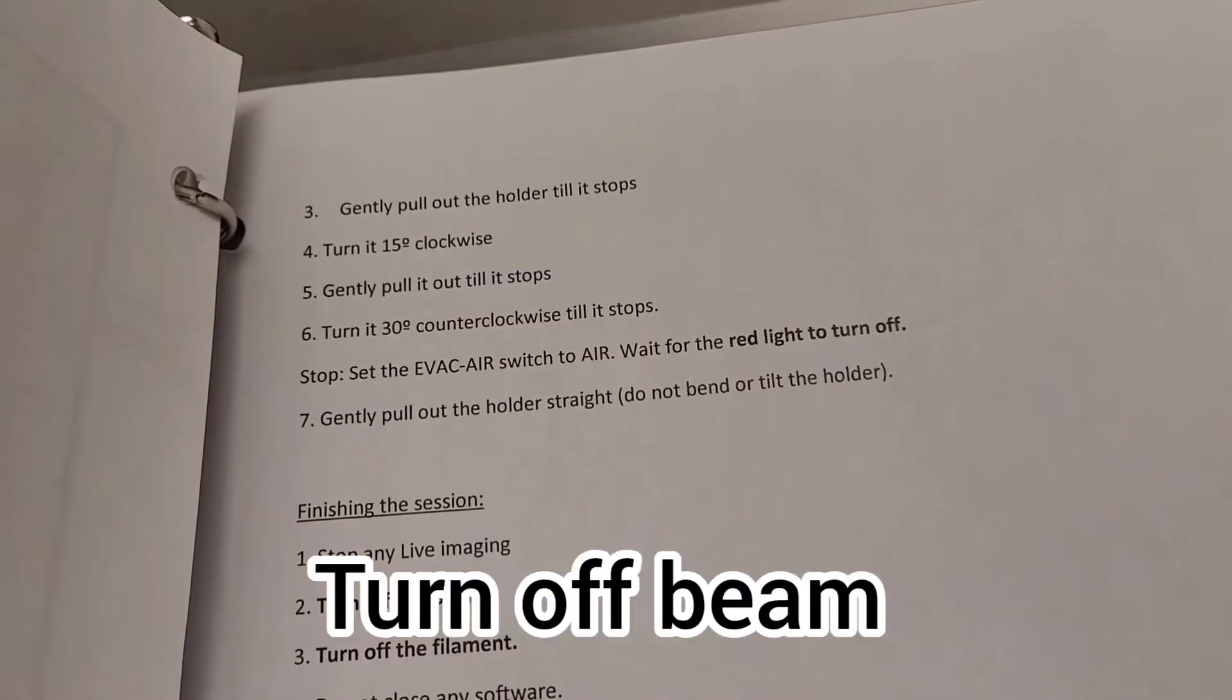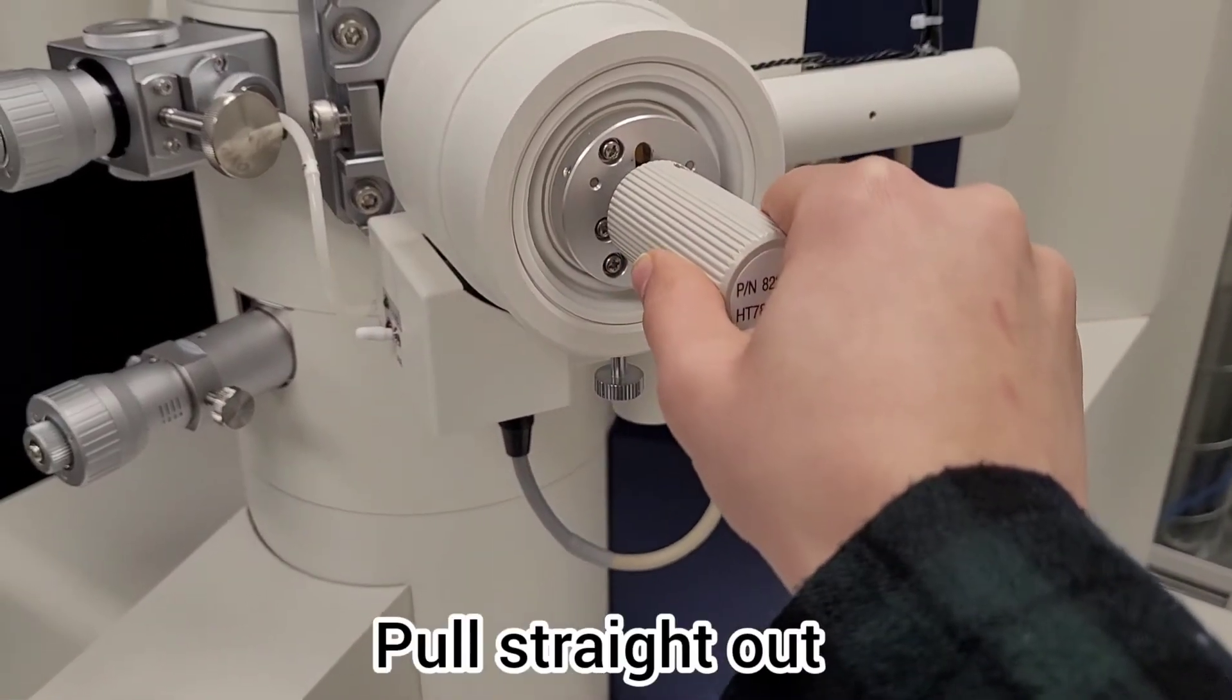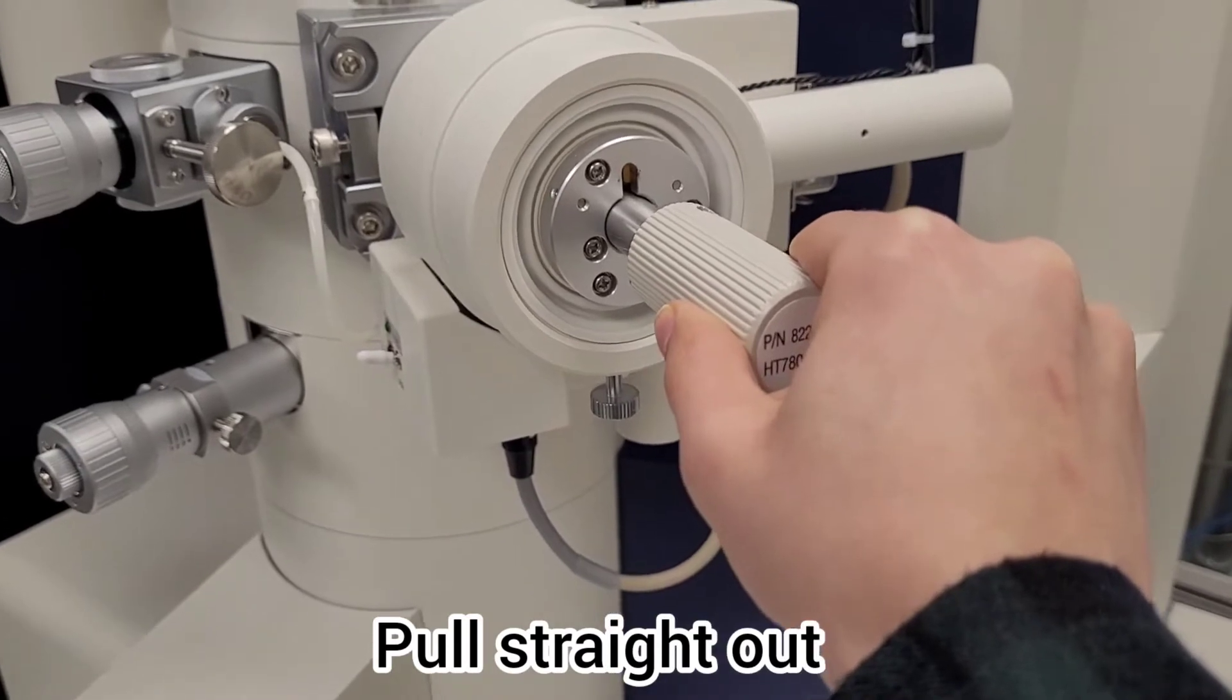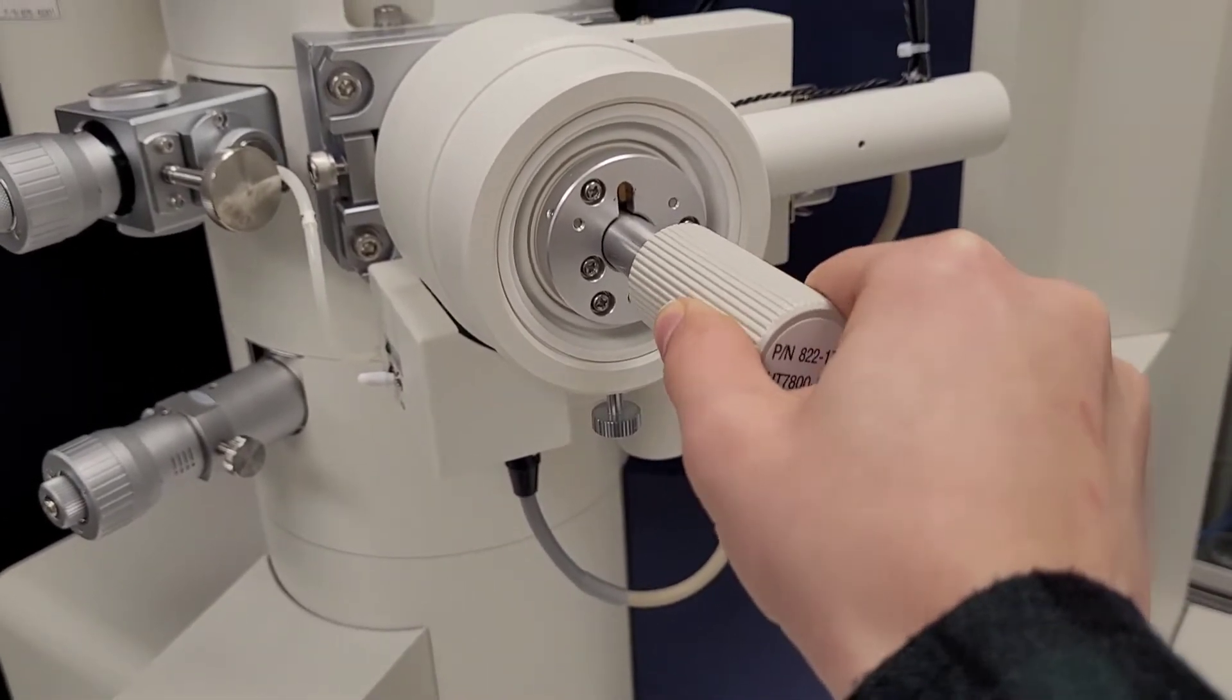Once you're done, you want to turn off the live view, turn off the beam, then you can pull out the probe.